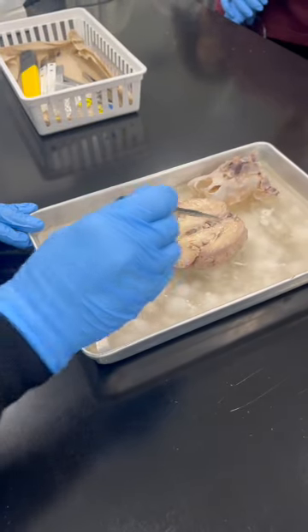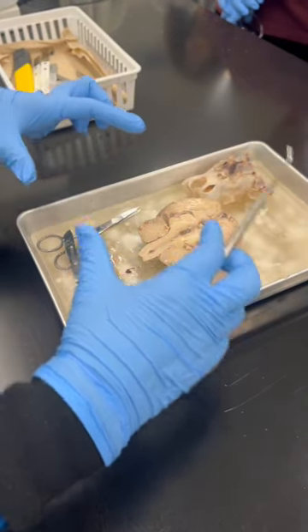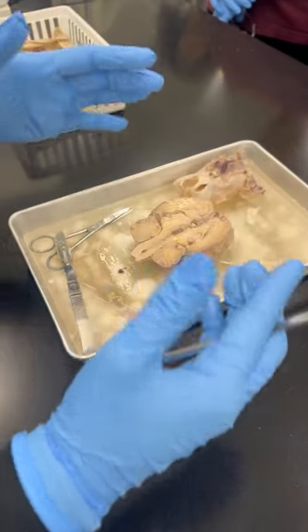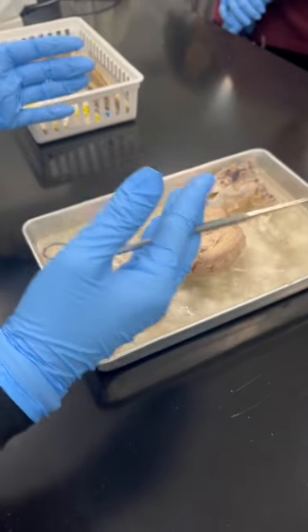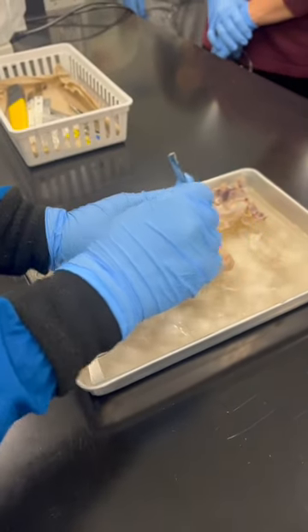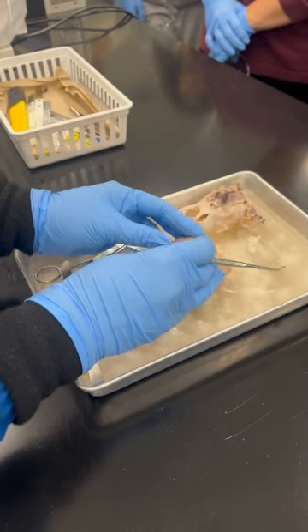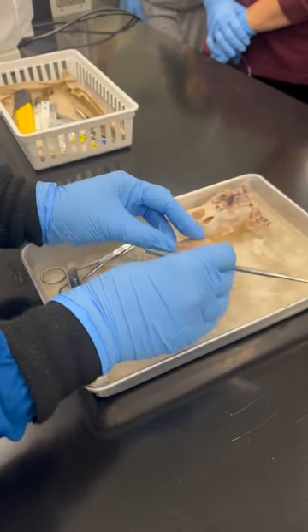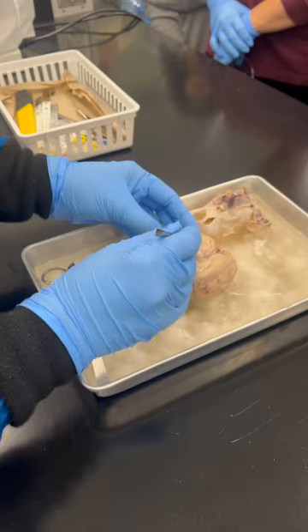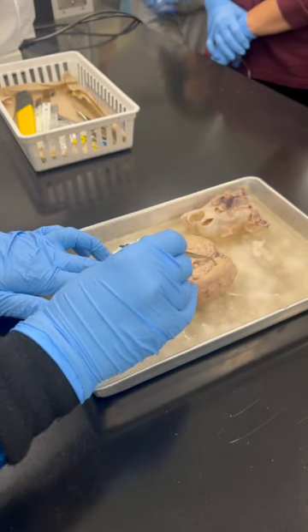Corpus callosum. What is the main function? They're connecting axons, connecting from what? The right hemisphere to the left hemisphere. So here is what? Longitudinal fissure. It's a division, a deep depression. Then something is connecting from here to here by what? This structure, the corpus callosum.